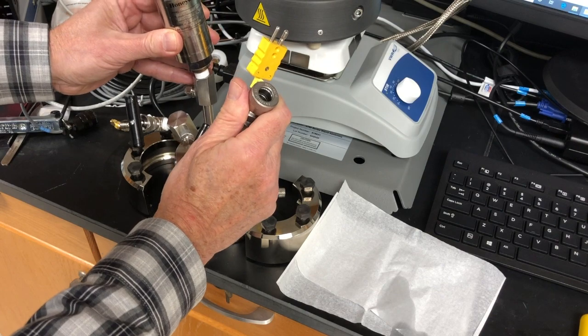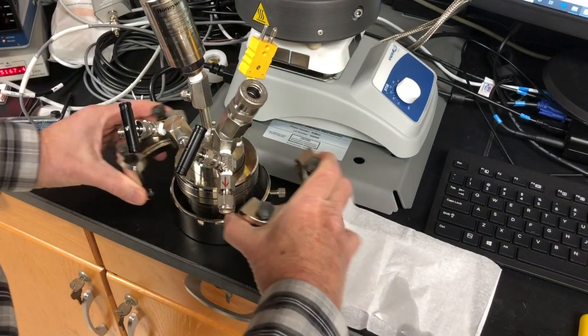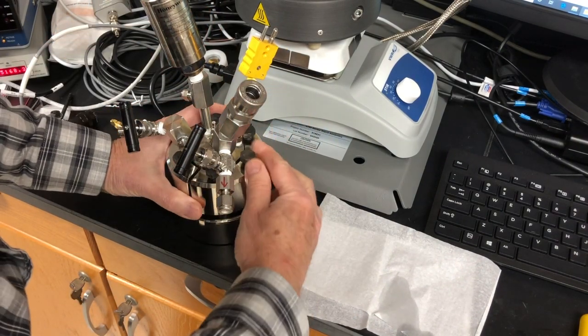Lift the reactor lid and carefully place it down on the reactor, making sure the crystal does not touch the reactor.